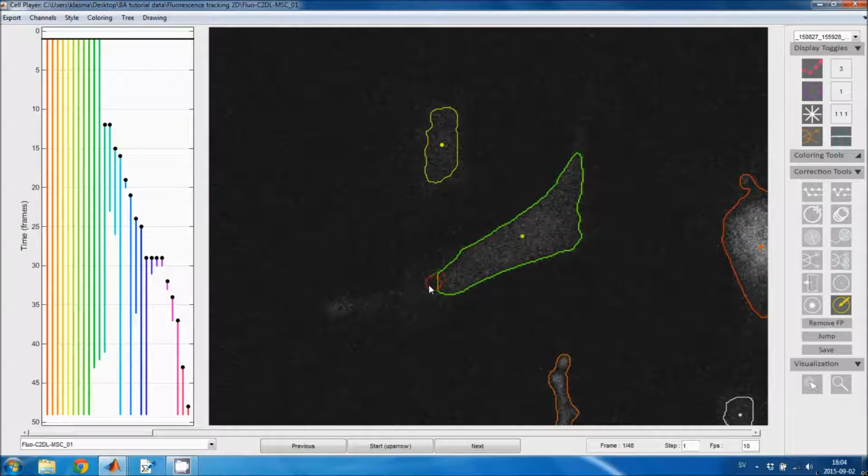I left click to draw and add pixels, and I right click to erase pixels. Then I drag a region. When I release the mouse button, the region is updated. I can change the size of the region using the scroll wheel of the mouse button, or by pressing the plus and minus buttons on the keyboard. I erase by using the right mouse button.